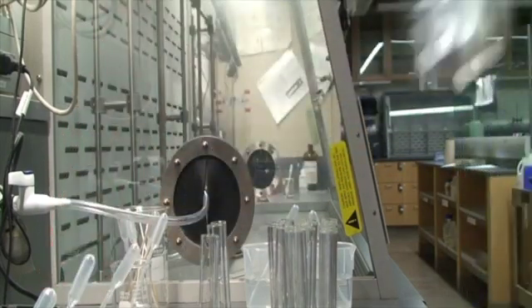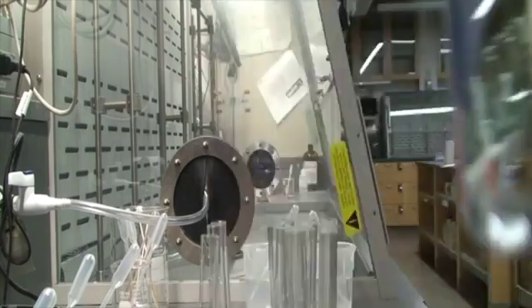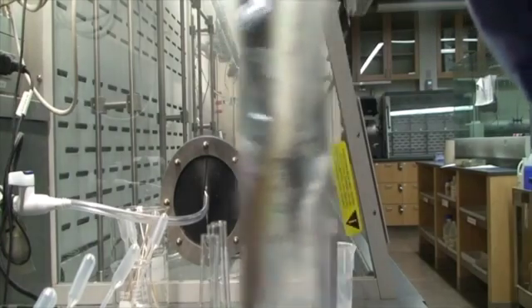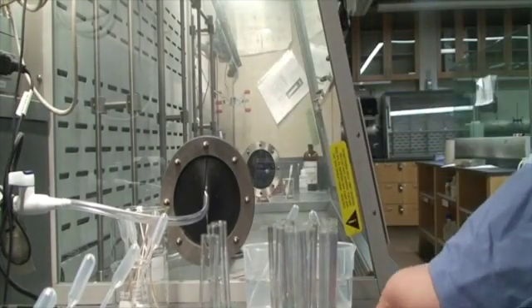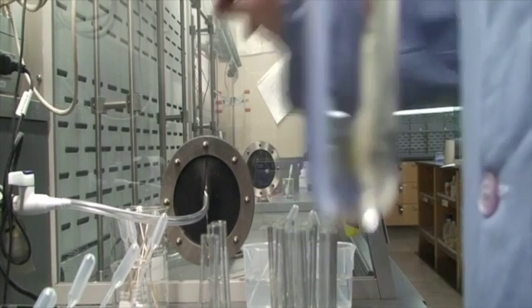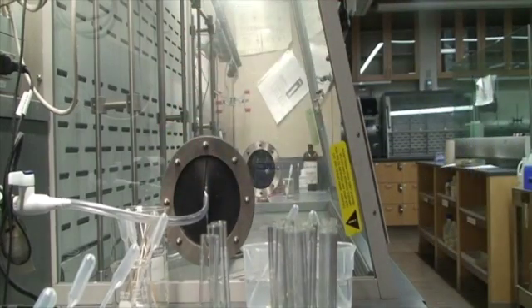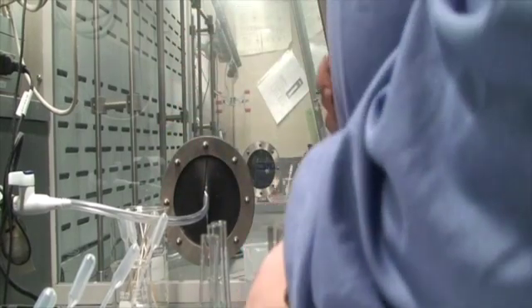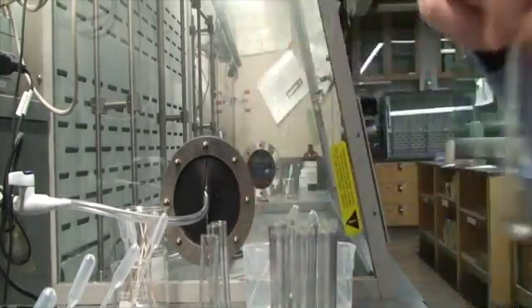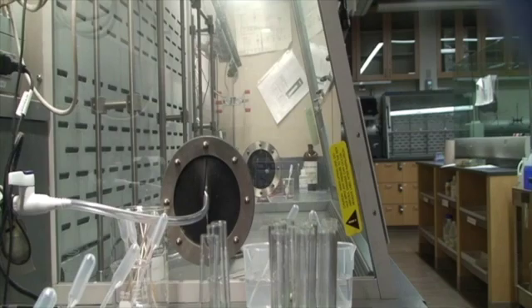Don't see a precipitate. I didn't notice any bubbling. Doesn't feel warm. And let's do our smell test. No smell. So that was 10 and 12. Okay, and then we're going to do 10 and 13, and we're done with the 10s. So here's 10.